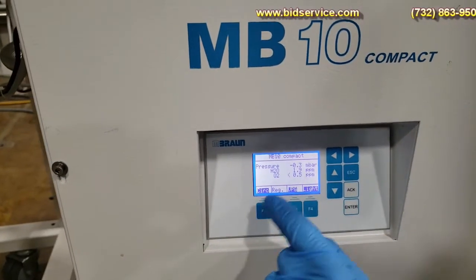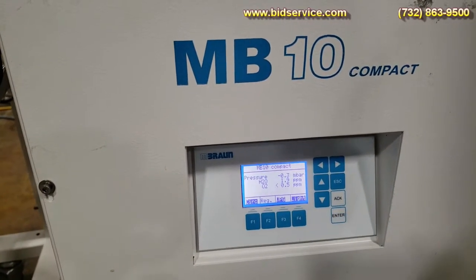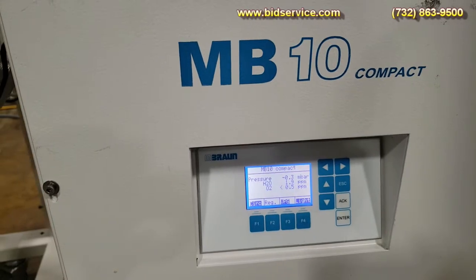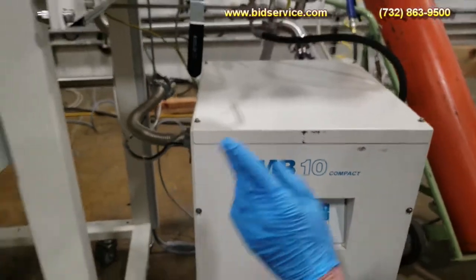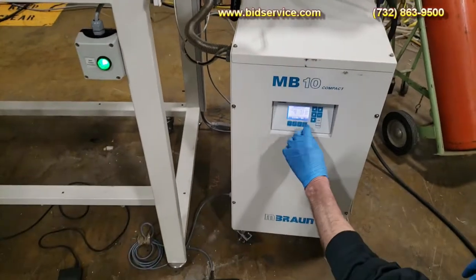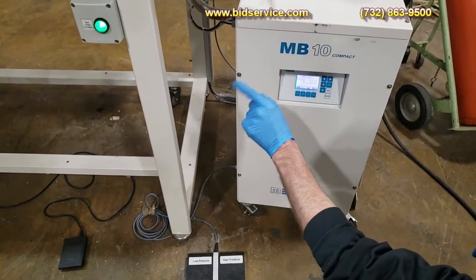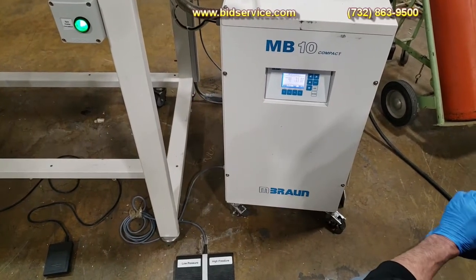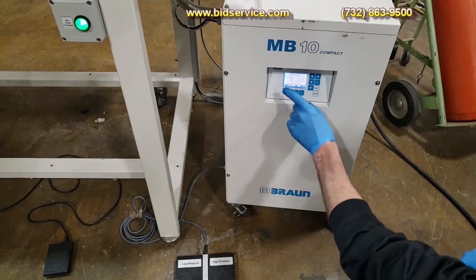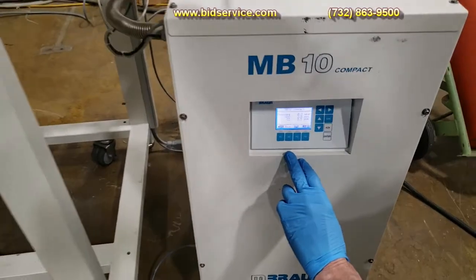I just want to point out the water is at 1.9 parts per million. I serviced the moisture analyzer using the phosphoric acid method, and it's taking a while but it is dropping. I expect within a day or two it should be below one. I verified that it is less than one using our house moisture analyzer, so the sensor just needs to catch up because of the service that was done.